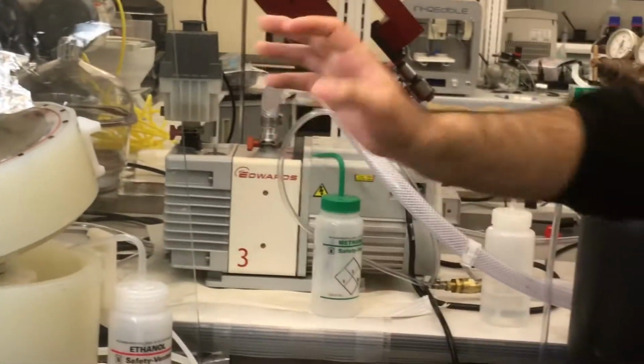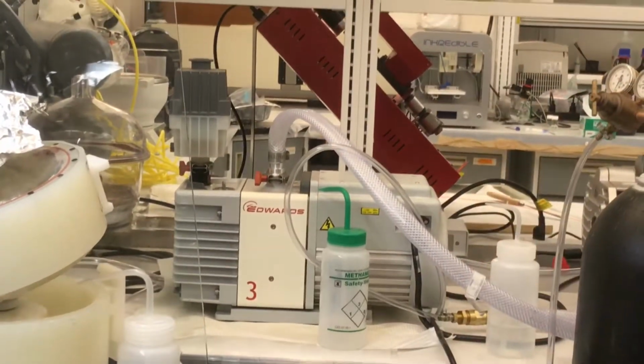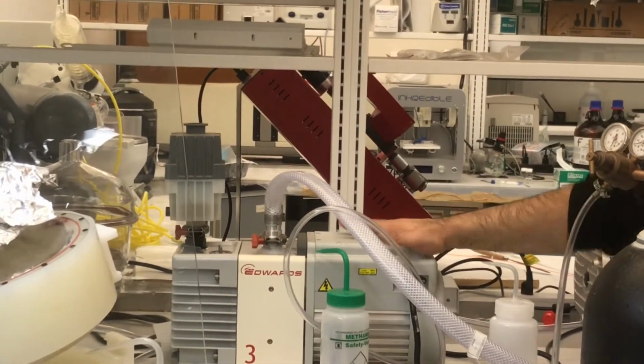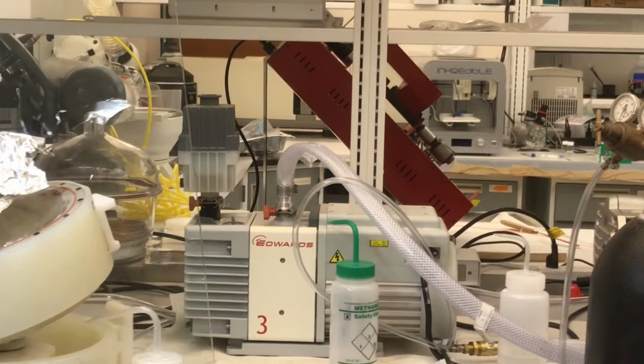But do not leave it. Put it here, go and do whatever you want, and then come back, this is totally wrong. Totally wrong, because what is the price of this pump? It's around 10 to 12k. So then they have to pay for it.